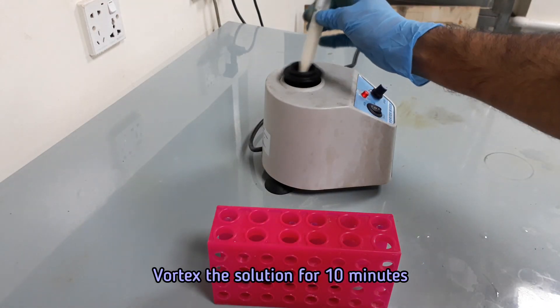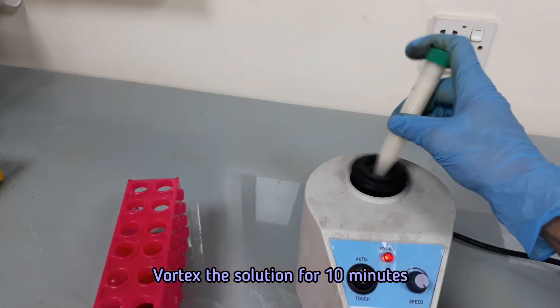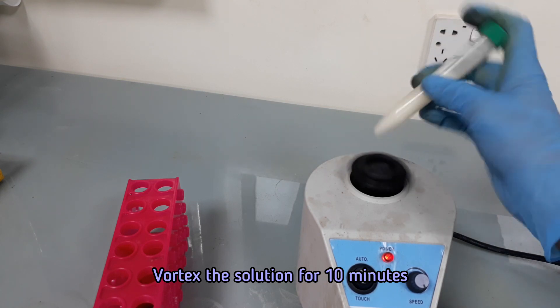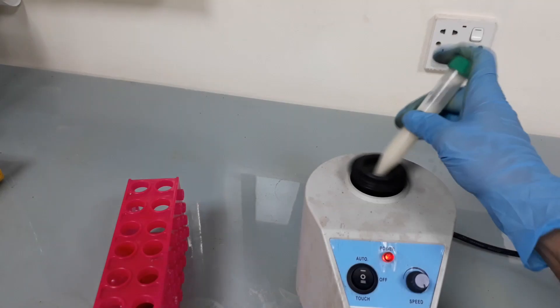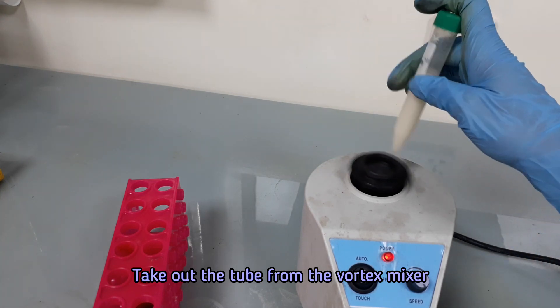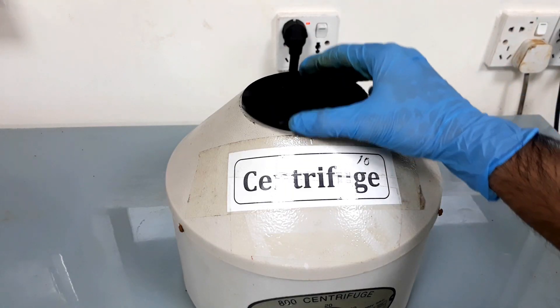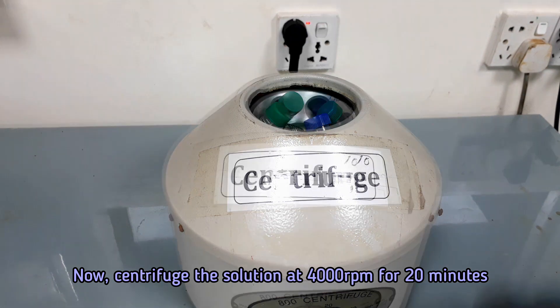Vortex the solution for 10 minutes. Now centrifuge the solution at 4000 rpm for 20 minutes.